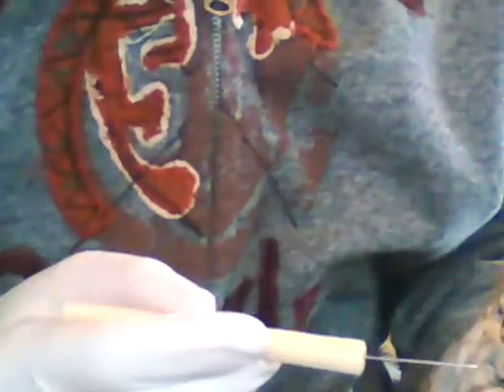From there we have, I think that's all before I have to flip it over. Yeah, I think so. Flipping over the brain, we have the inferior view, you could say. Obviously down here is still the cerebellum and the medulla oblongata. Further up, right above that, right there, is the pons, which is very important.